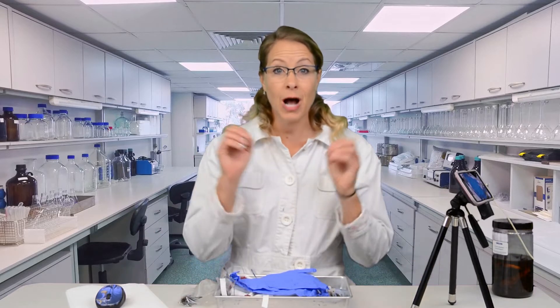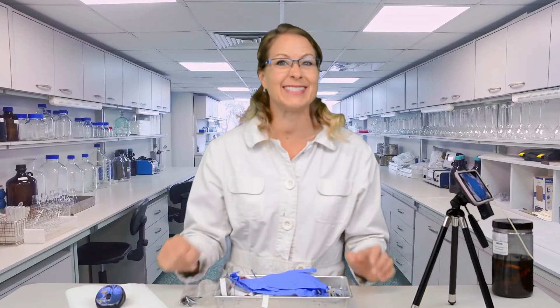Hello Lab Rats! Welcome to Lab Rat Academy. This is the third week of our basic anatomy lab where we will be dissecting a grasshopper. This grasshopper is probably something you've never seen before up close and personal like we are doing today, so we're going to learn some really fun stuff.